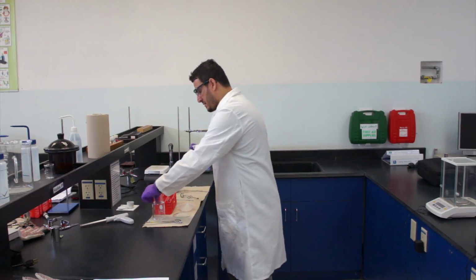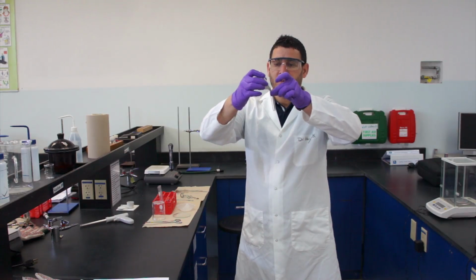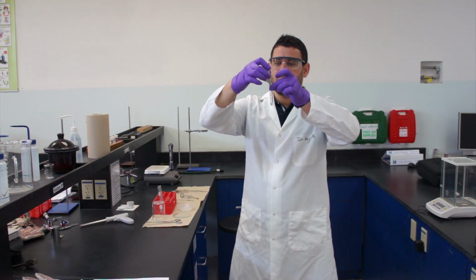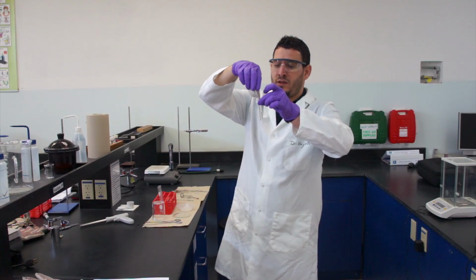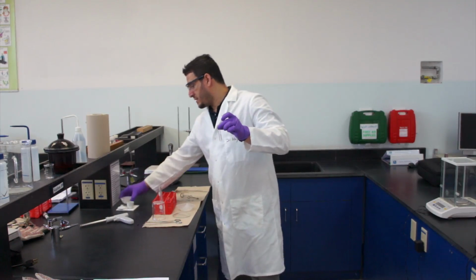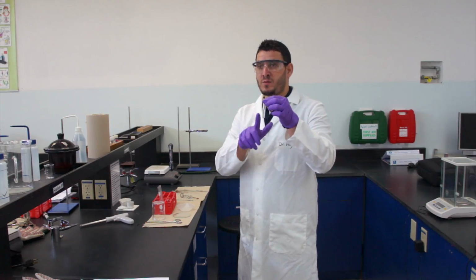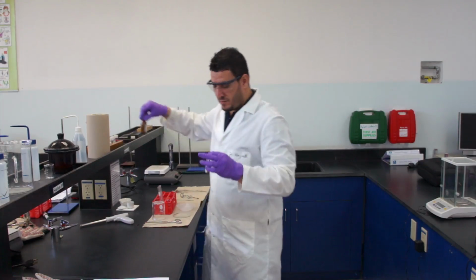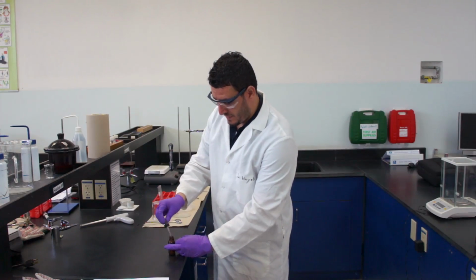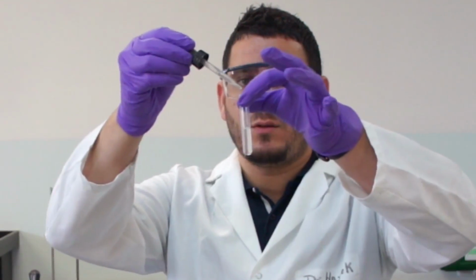And I will take a clean test tube and I will add the solution to it. So I want to repeat the test with the silver nitrate with the solid in this evaporating dish, to see whether it will give me the same observation as the solid before heating, okay, as the sodium chloride before heating. So now you take silver nitrate and we will add a few drops again to see what is going to happen.